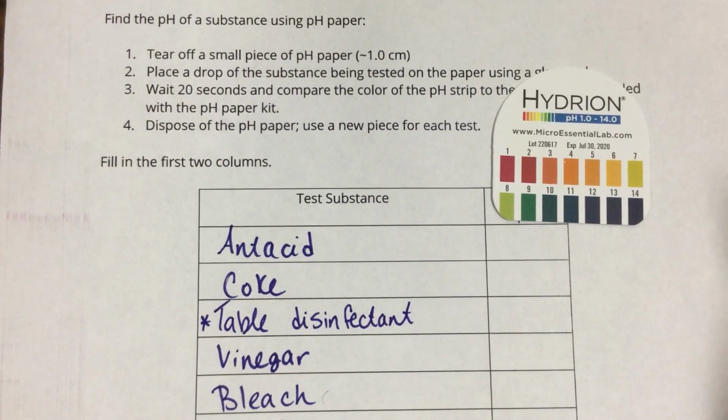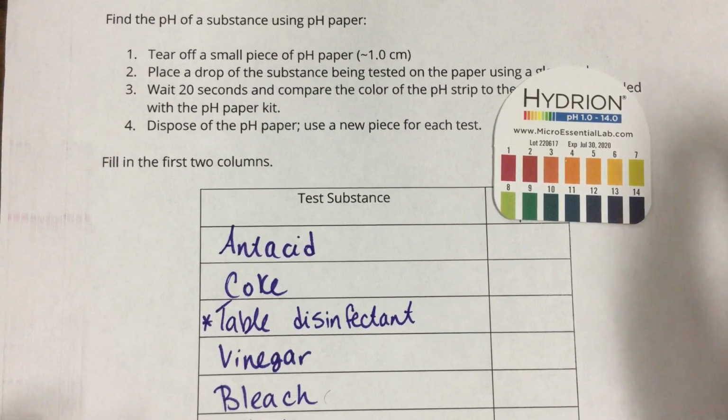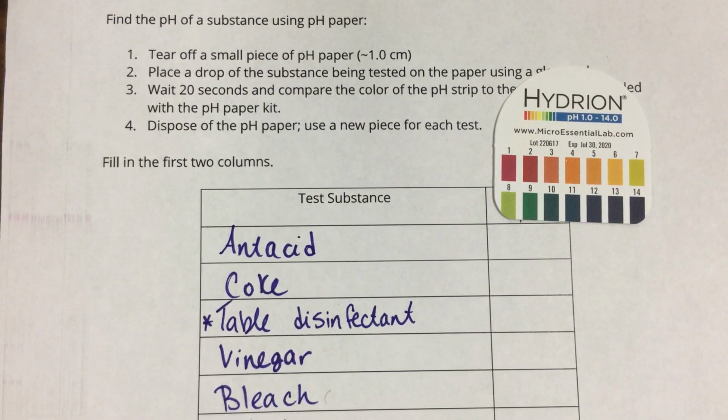All right, so today I'm going to demo a lab that you would normally be doing in class. I wish y'all were here so we could do this together, but that's okay. I'll do this, and that way you can watch this recording and take your data about the lab. For this lab, we're looking at pH graphing.